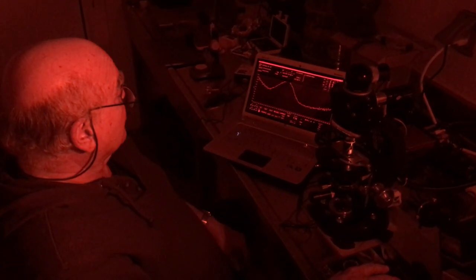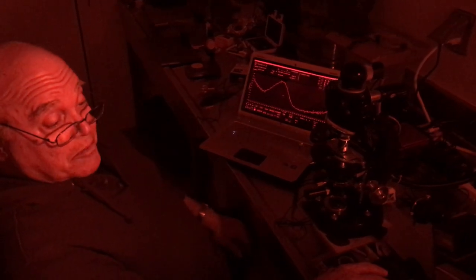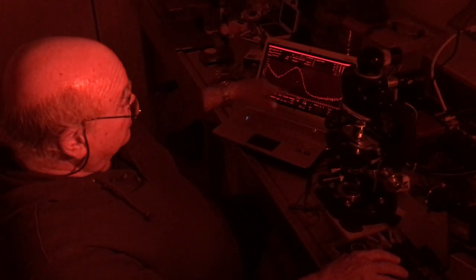Scanning back and forth, it absorbs very little out here in the red. As I move into the green, blue-green part of the spectrum, it absorbs, and then starts to go up in the near-ultraviolet. If this visual pigment is in a particular photoreceptor cell, then this represents the sensitivity of that cell to various wavelengths of light. So this cell would be very insensitive in the red but maximally sensitive here in the blue-green.